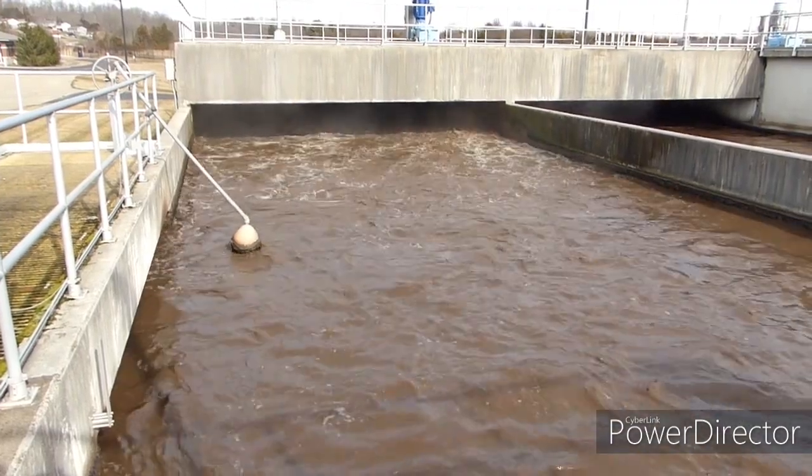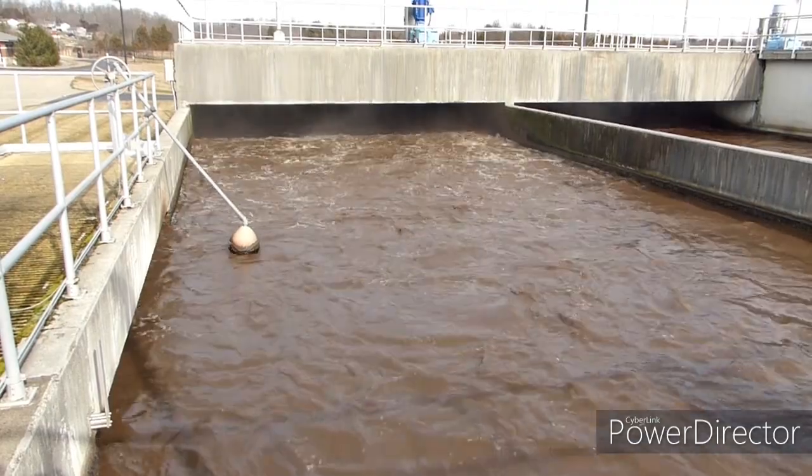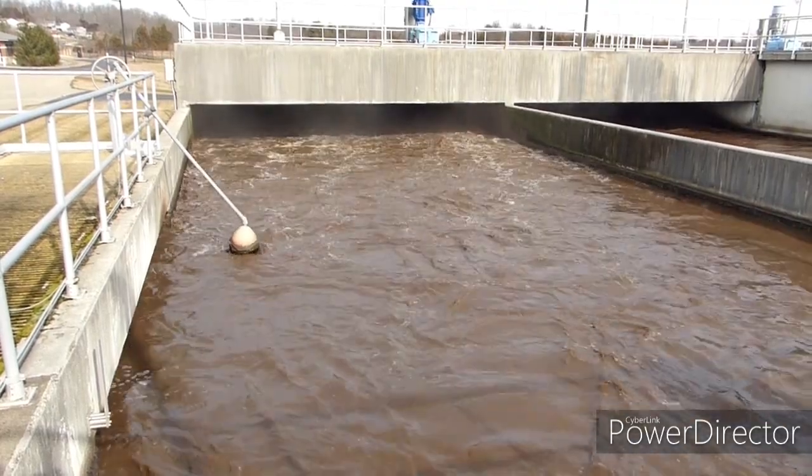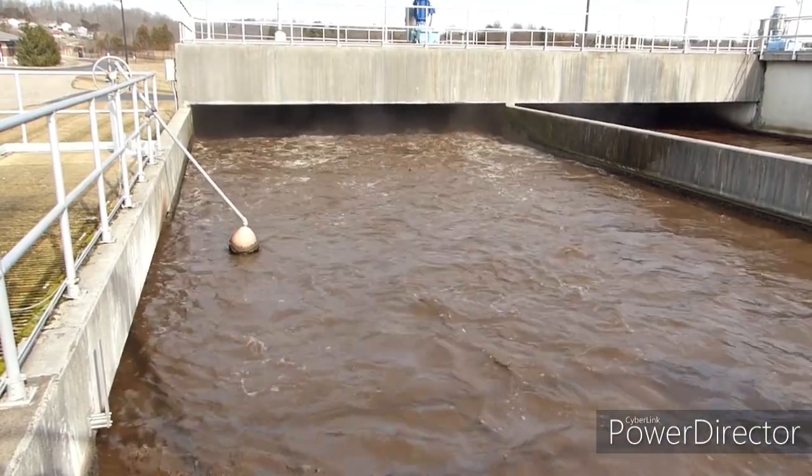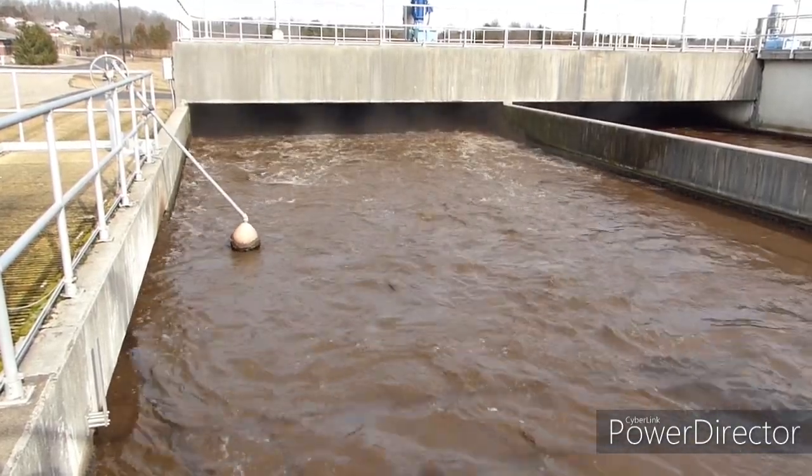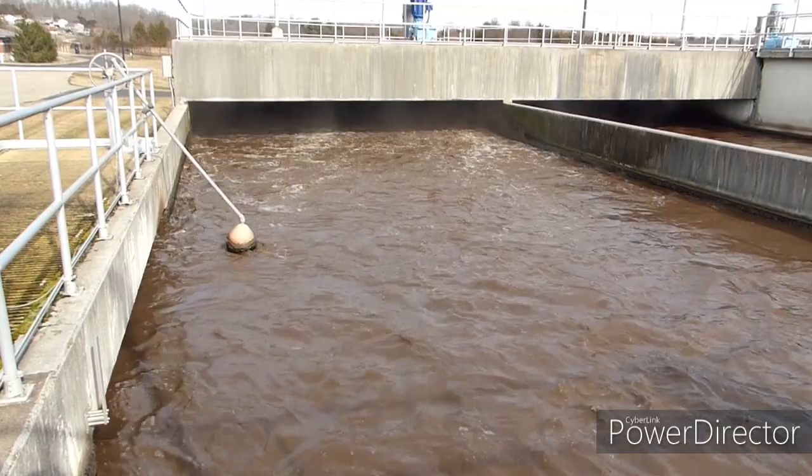One simple test that can be performed by the operations staff at a wastewater treatment plant is the sludge settlability test. This quick and easy test helps operators know how mixed liquor will be settling in the secondary clarifiers.